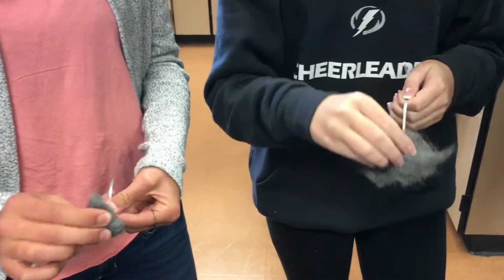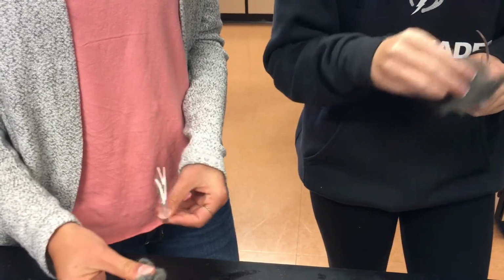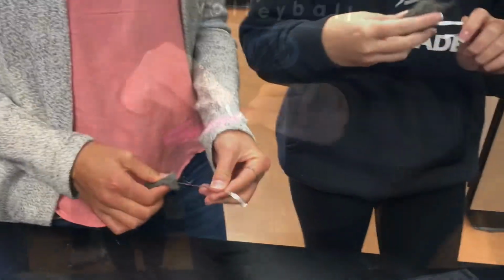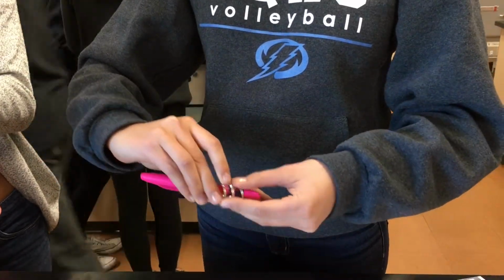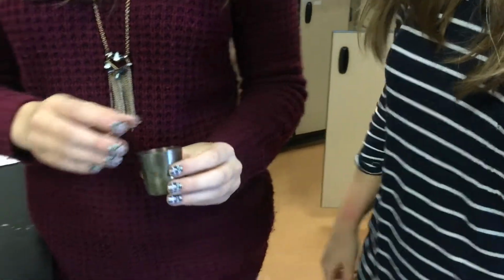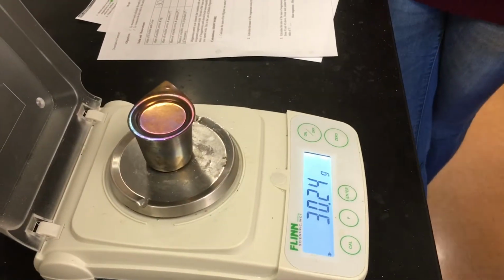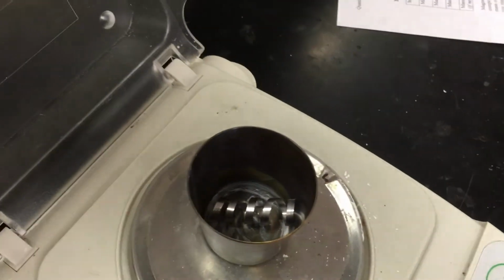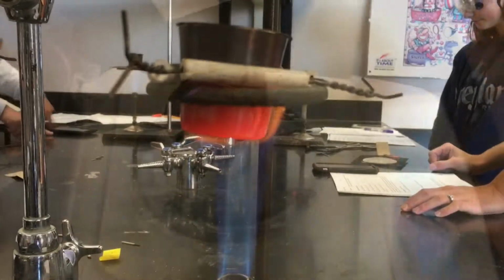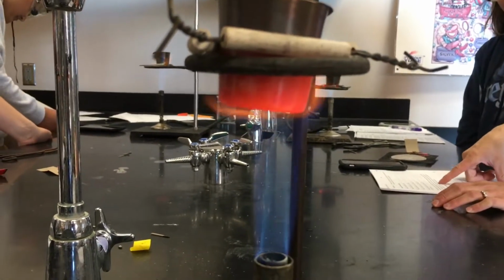It's just half a ruler, right? No. Cool. Mr. Roger. Yeah, we have to show patience. Where's our magnesium? Is this good? That's in the dude. Okay. Are the lighters on? Yeah. See, he's looking for matches. We should be scientists. It's really long. Good. Four minutes. You should be scientists.